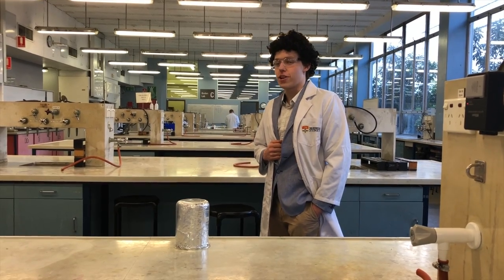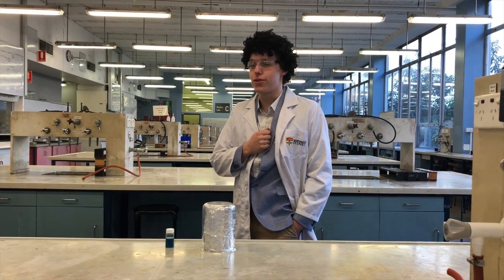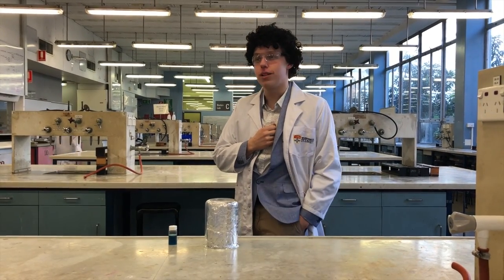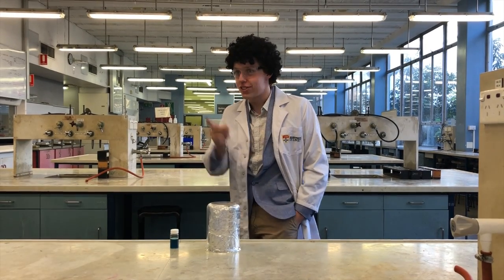In this MasterChemist pressure test, you'll be synthesizing silver nanoparticles. Nanoparticles of silver are between 1 and 100 nanometers in size. Their color is dependent on the shape and size of your nanoparticles. You can find them in biosensors, antibacterial chemicals, and nanowires. But what are you waiting for? Your time starts now!